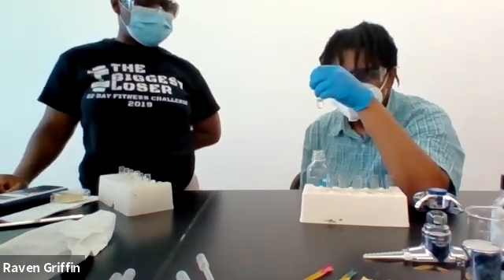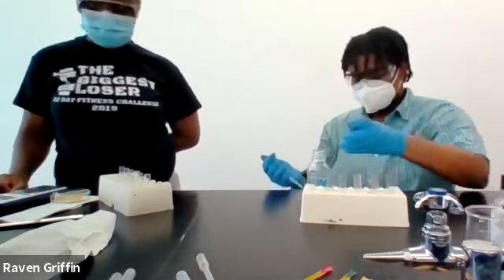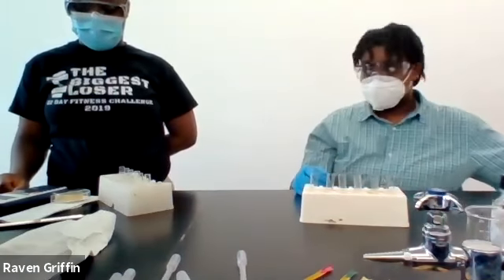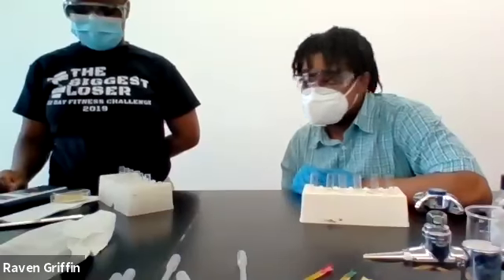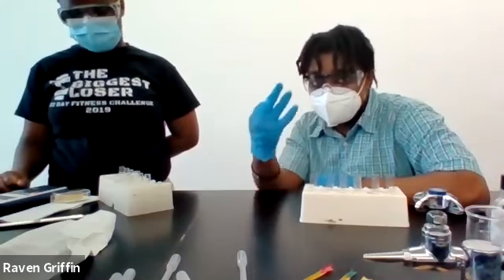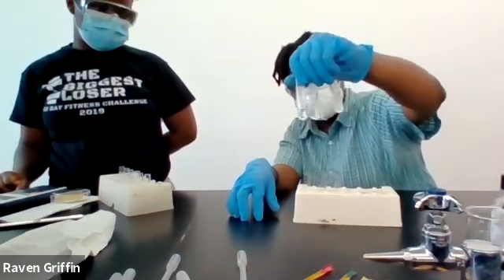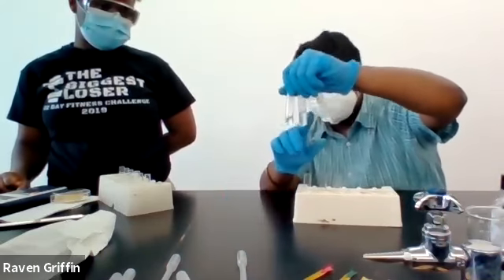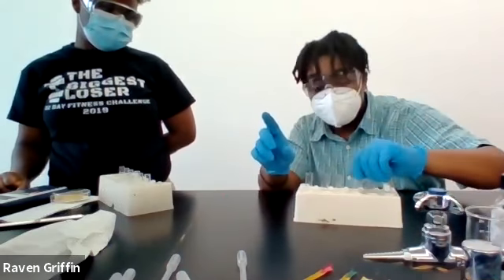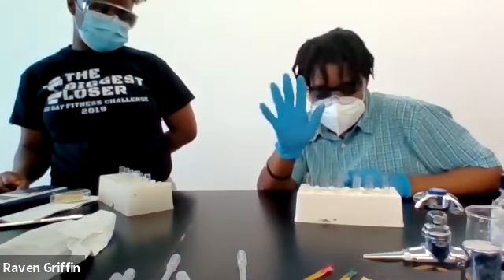I'm not seeing anything with that copper. Right, so last part we tested how magnesium and copper react with 3 different acids of the same concentration. All the magnesium ones reacted very strongly with phosphoric acid, HCl, and sulfuric acid. They all got warm, they all started bubbling. The metal strip got smaller and smaller until it disappeared.